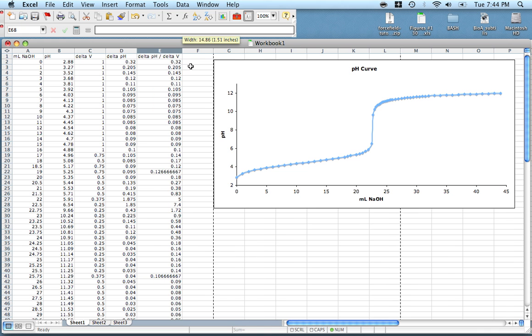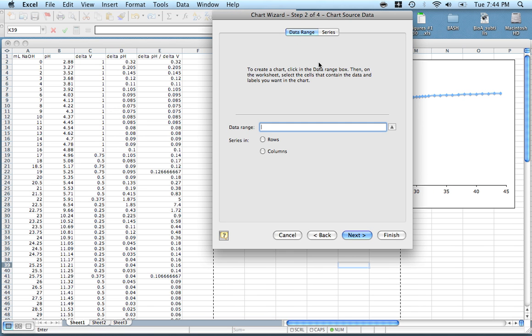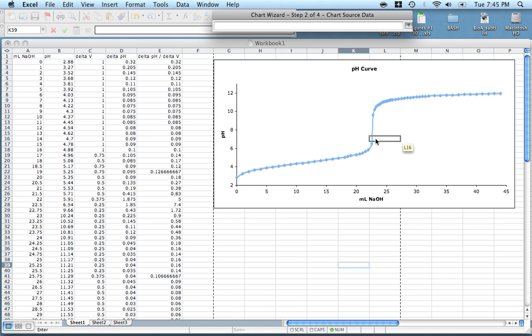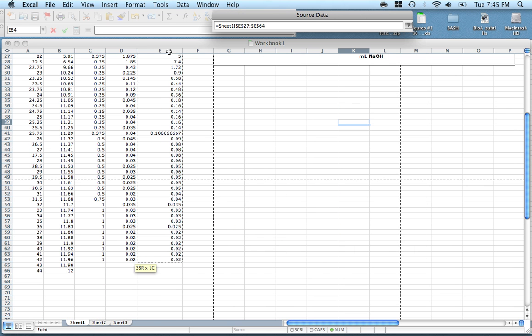That honestly is the hardest part of this whole thing. So now what we want to do is plot this column on the y-axis and this column on the x-axis. We just click somewhere out in space here, go to Insert, and add a new chart. I'm just going to do a scatter plot. Going up to add a new series, click this to minimize it. Then for the x values, we just want to select all of our milliliters, and for y values, we just want to select all of our slopes.